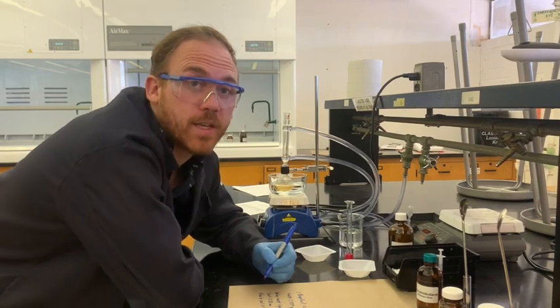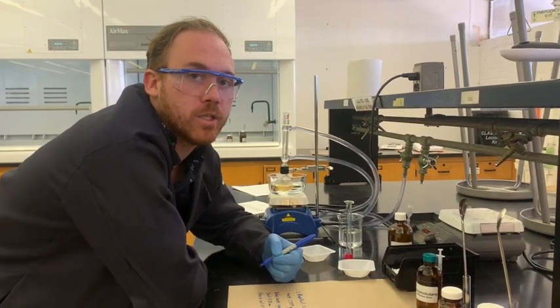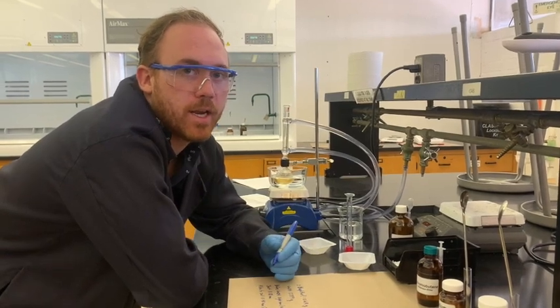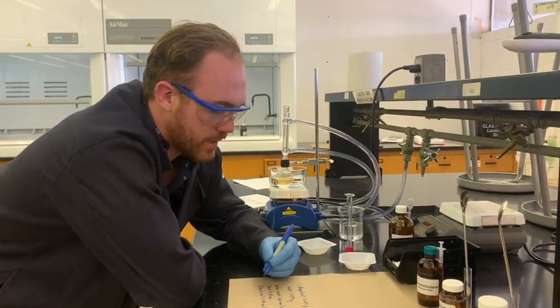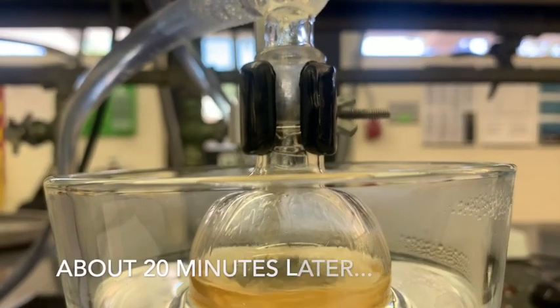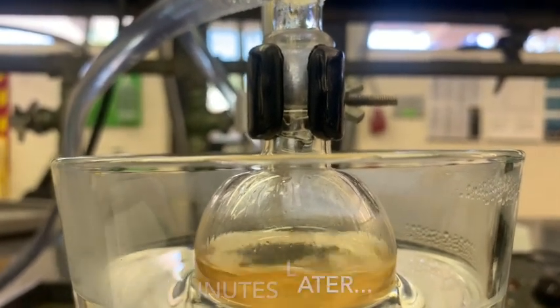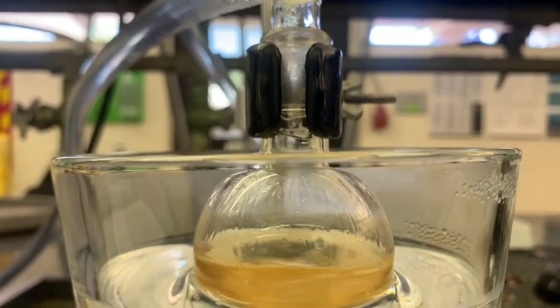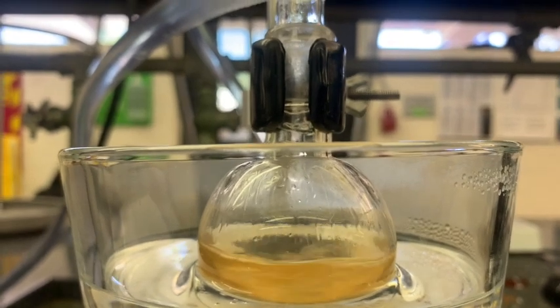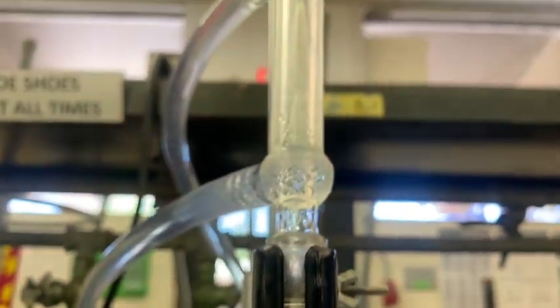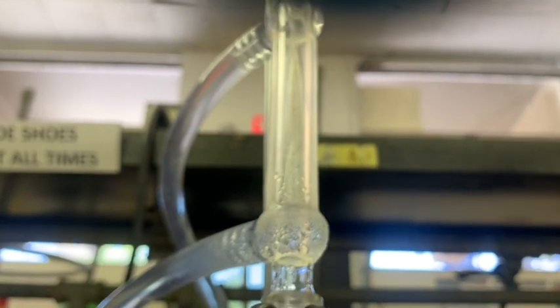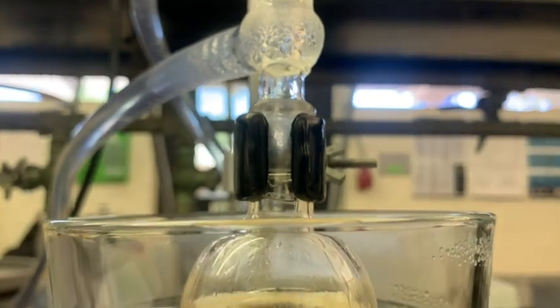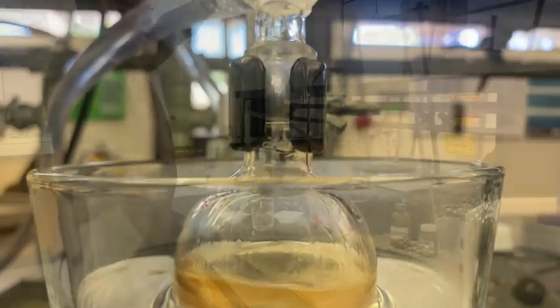Remember, every 10 degrees Celsius you increase for any kind of reaction, you're going to have a rough doubling of the reaction speed in any kind of solution-based chemistry. So this is what a proper reflux looks like. You're seeing that you have solvent boiling in the actual flask, going up the condenser, getting condensed by the cooling water, forming drops, and then slowly making its way back into the flask.